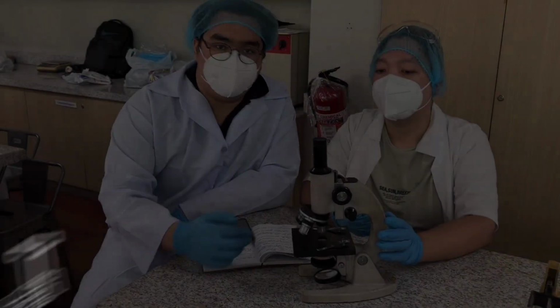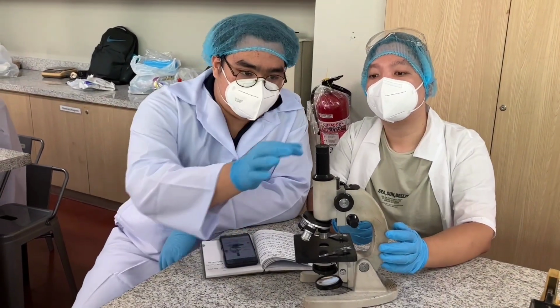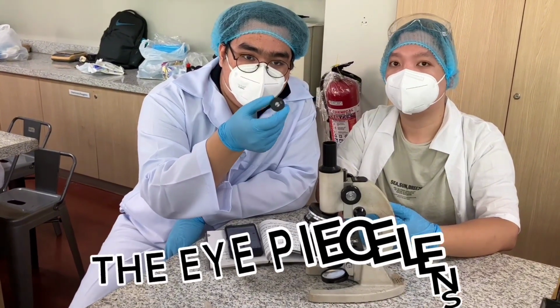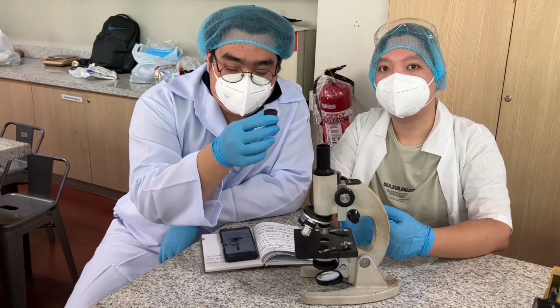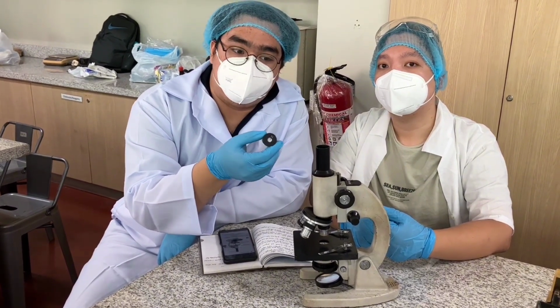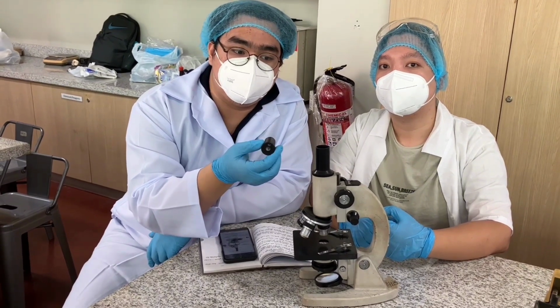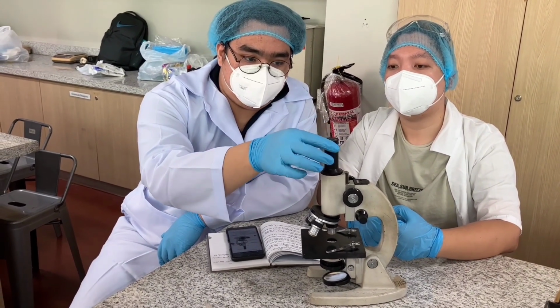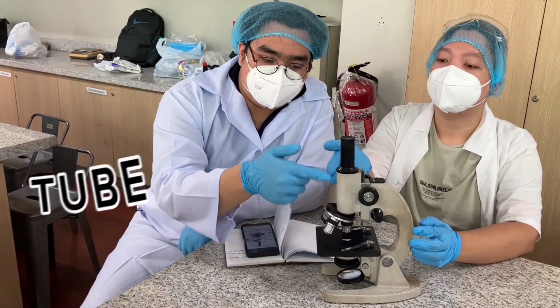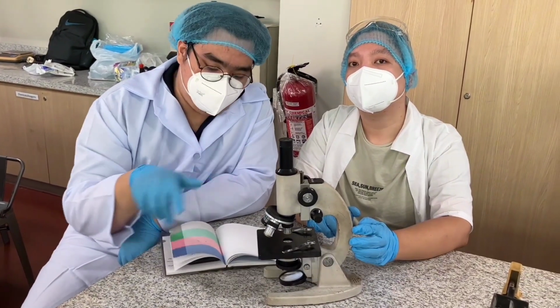Now, the first part of the microscope after the large components is this. This thing right here is called the eyepiece lens, and its main function is to provide a specific magnification when observing our specimen. It is completely removable, so it can adjust to any magnification you want. Slides right here easily. Now, this thing is the tube. This is like the neck of the microscope, and this is where some of the components can be found.